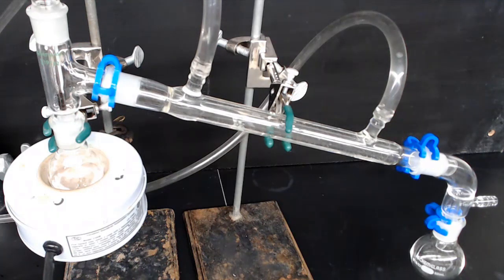Then you'll notice vapor starting to condense in the condenser, becoming a liquid, and rolling down the condenser into the collection vessel. Tert-butyl chloride boils in the range of about 48 to 52 degrees Celsius, so you'll want to collect the fraction that boils in that range.